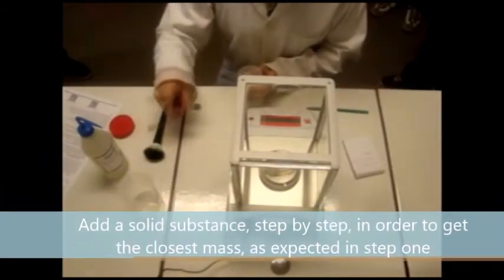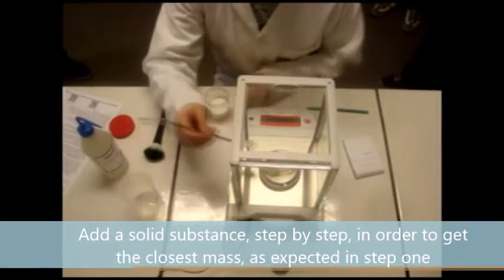Add solid substance, step by step, in order to get the closest mass as expected in step 1.